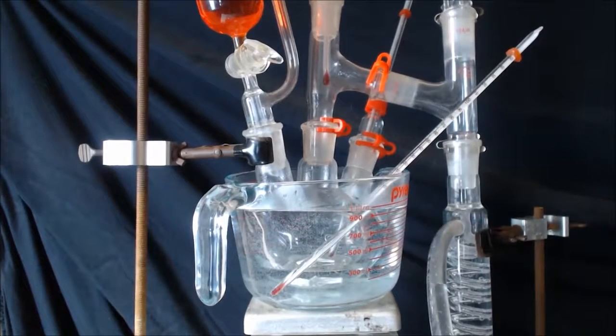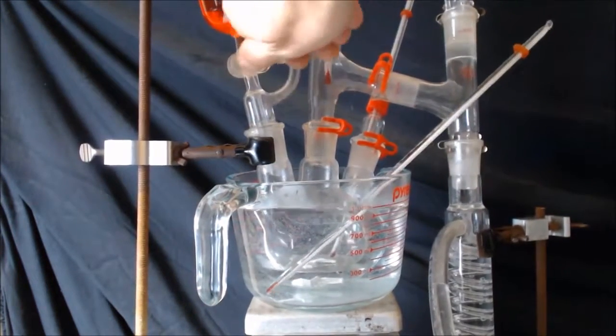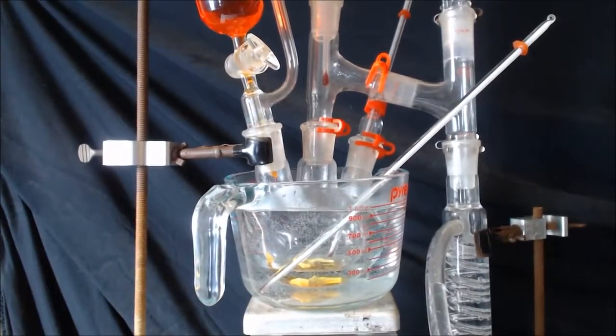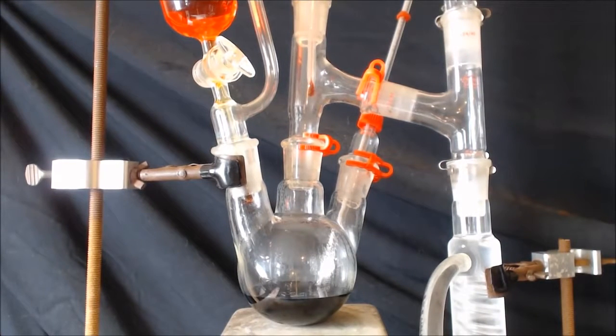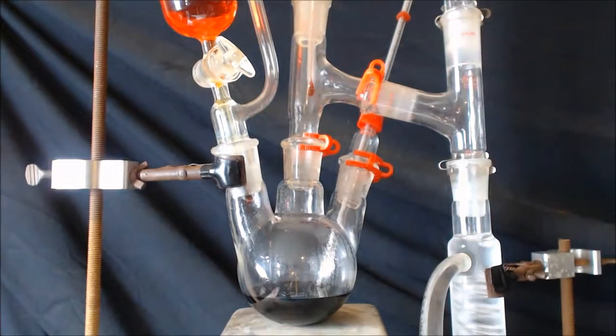Alright, I have the water at 50 degrees Celsius. Hopefully that's enough. I'm going to start dripping a little in. You can see it's starting to turn green a little bit. Well, subtle heat isn't working, so I took the water bath off. I'm actually giving it some heat. Have a hot plate up to 111°C.